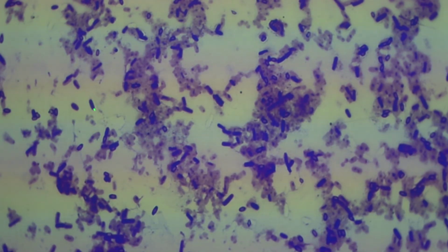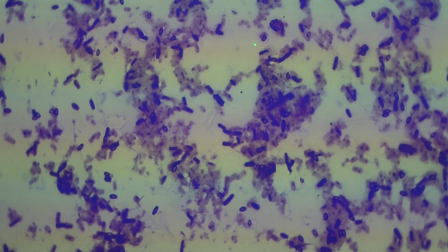Here's a great view, and this is what I'd like you to draw in your lab manual. You can see many vegetative, thick, hot dog-shaped rods. Draw those and make a note that they are vegetative. That is a term that means actively metabolizing. And then we also have the spores I want you to draw. And there may actually be some examples where the spore is forming inside the rod while it begins to decay. And you may draw that as well. Okay, so those are our 4 bacteria.